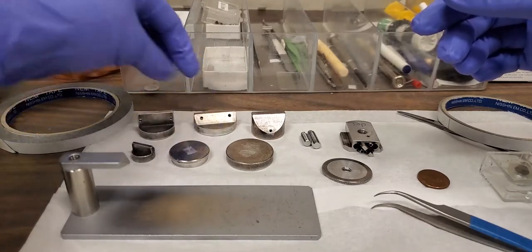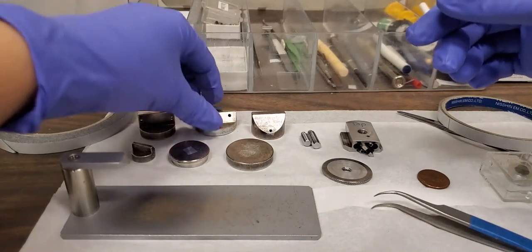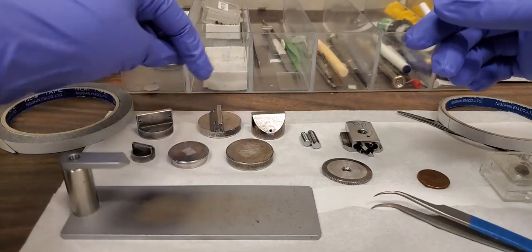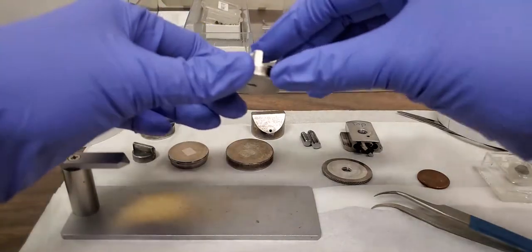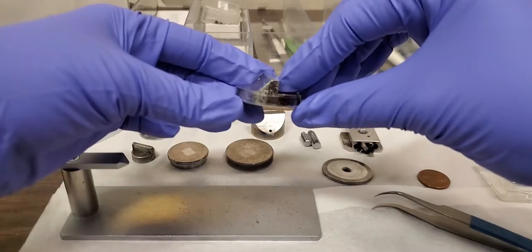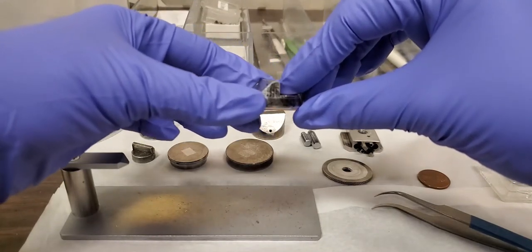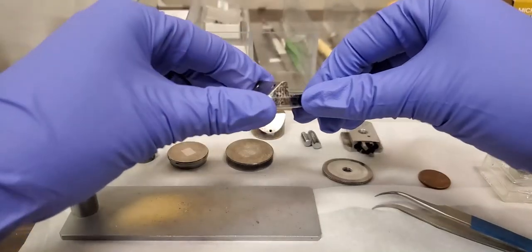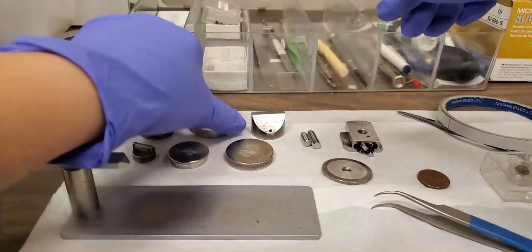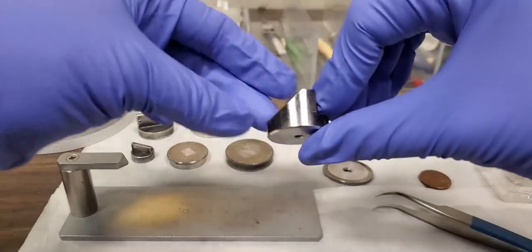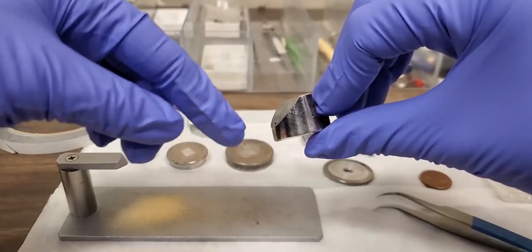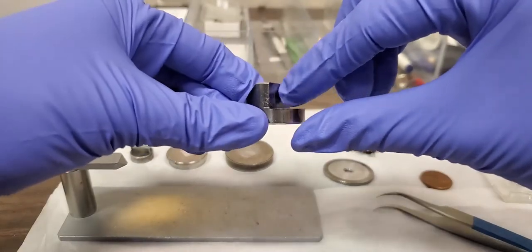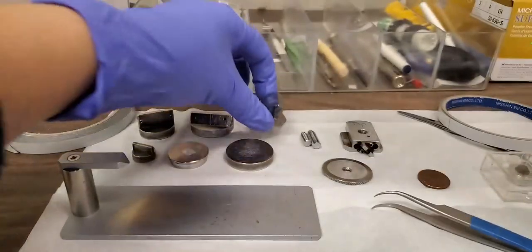This one is not the same as this. This is for perfectly perpendicular. This one has a predefined 45-degree angle, which is more than you're going to be able to tilt inside the SEM. So you can use this one to look at your sample. This is the same as a larger edge. You can also use this side for the flat cross-section.